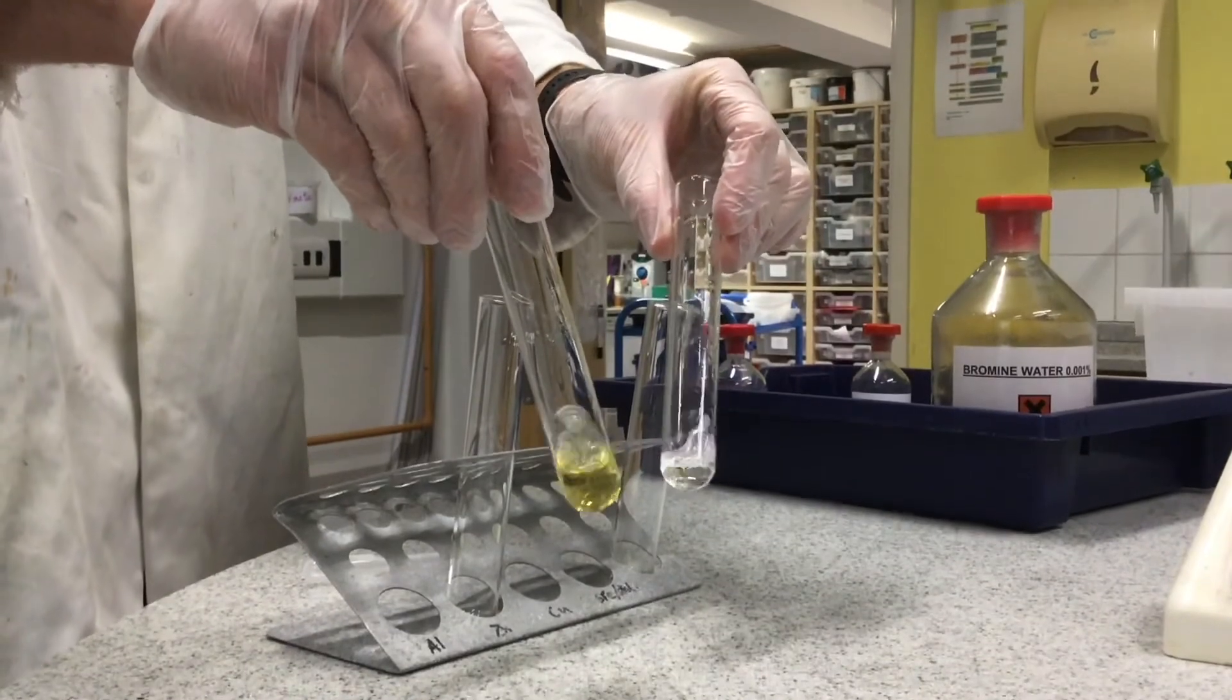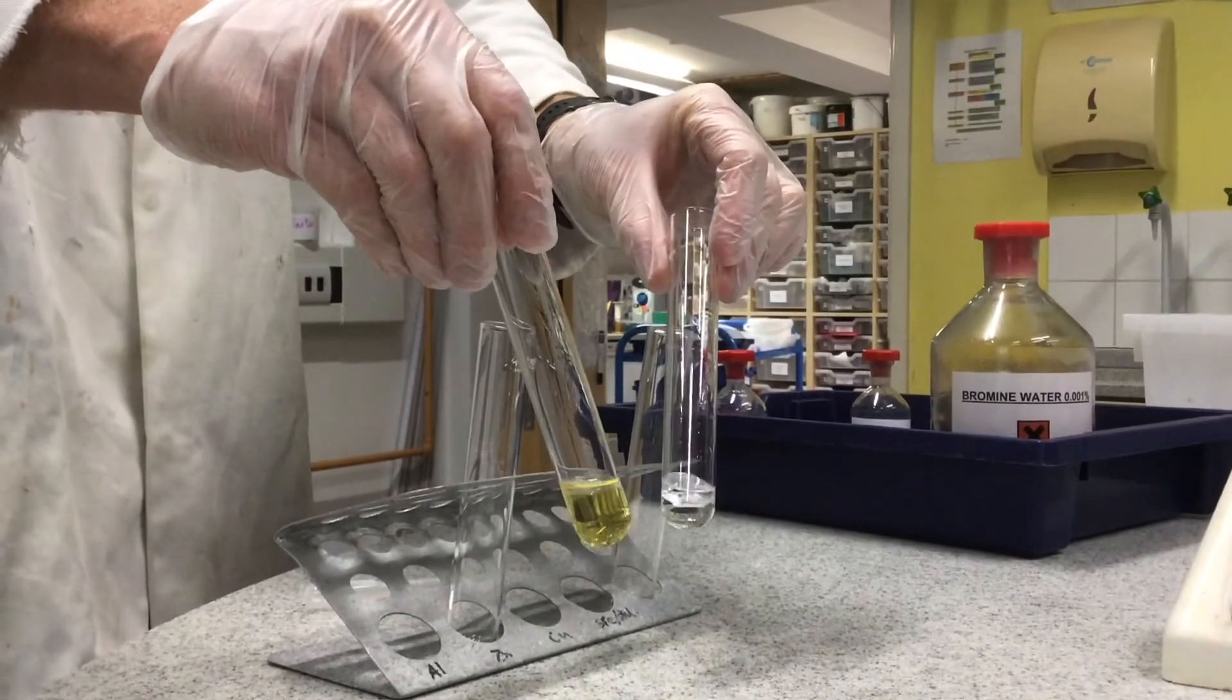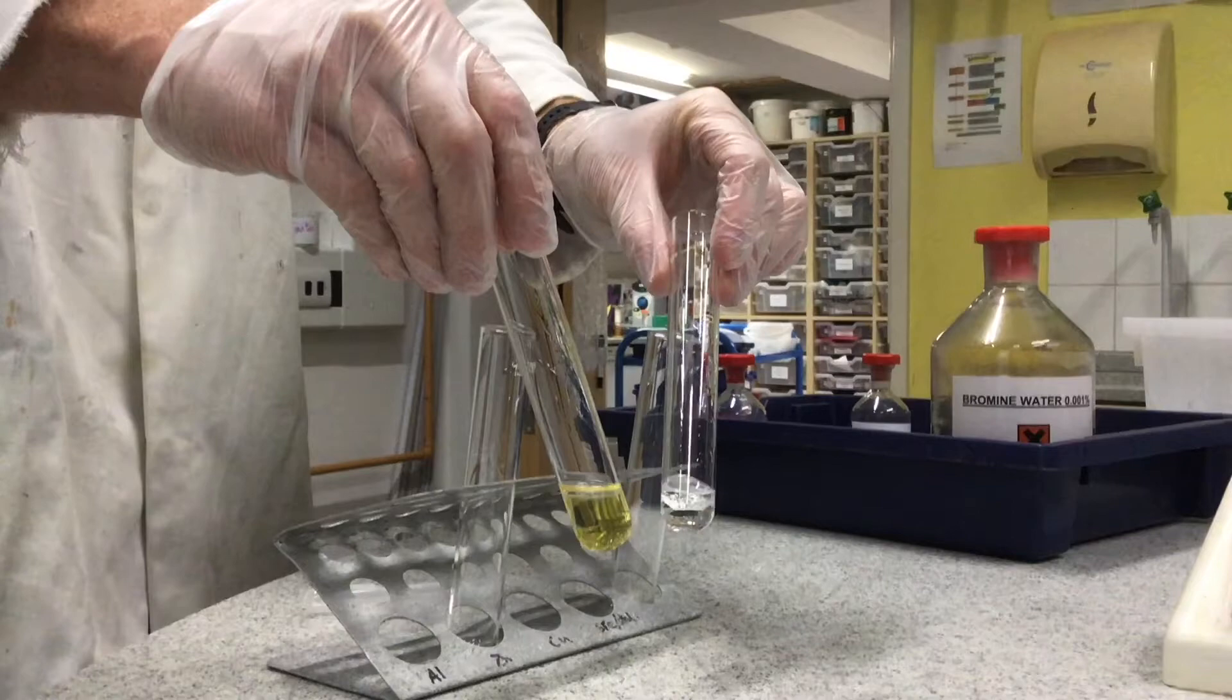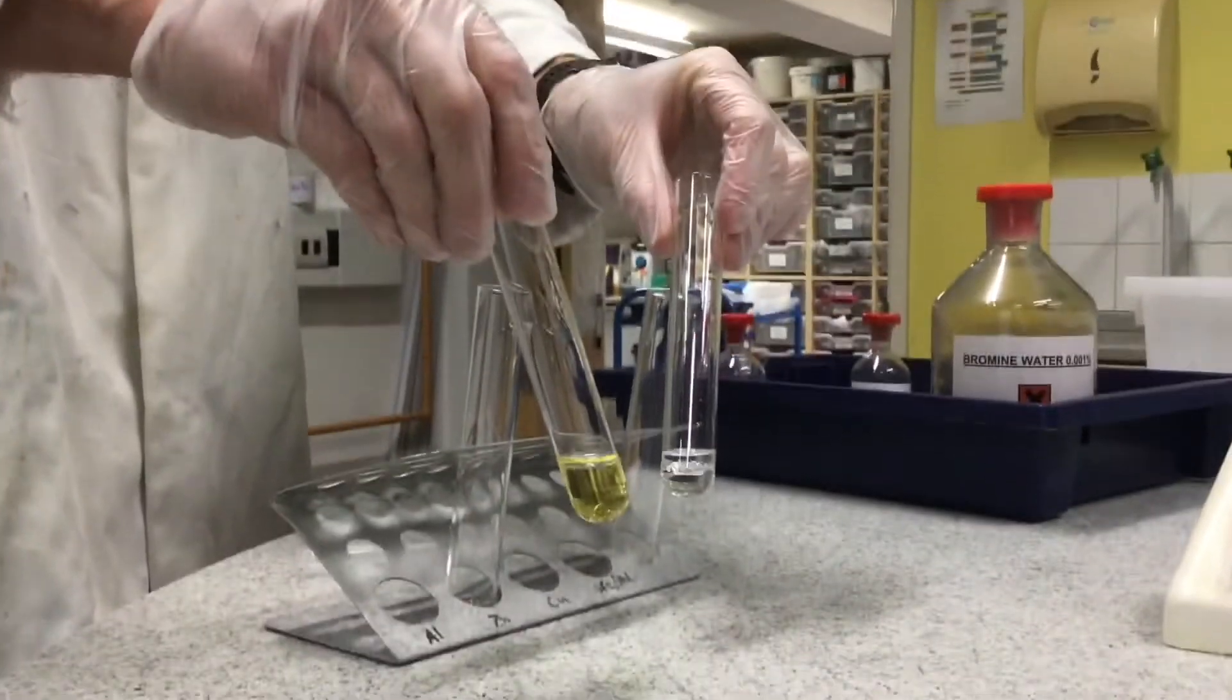So you can see the difference between the two there. The substance on the right was the alkene which has reacted with the bromine water.